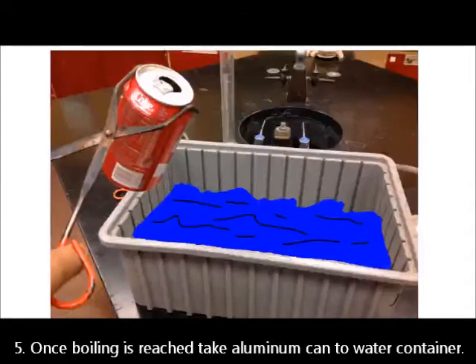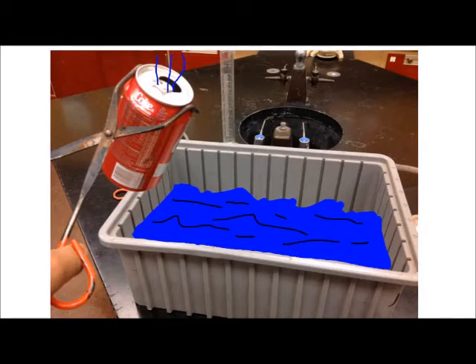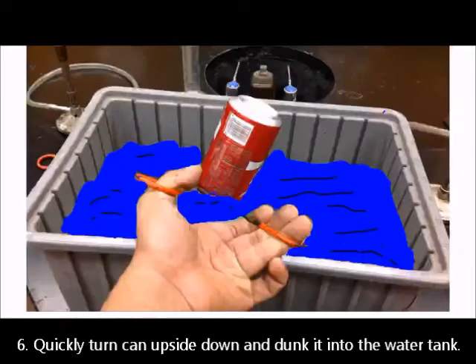At this point, the water in our can is boiling, and steam is coming up, so we're going to take it over to our water tank. We are then going to quickly flip the can over and dunk it into the water.